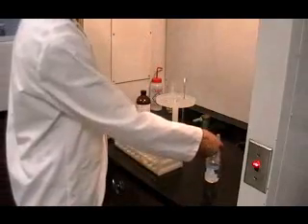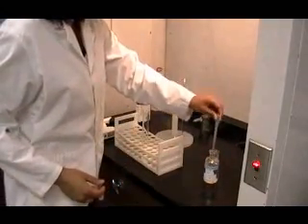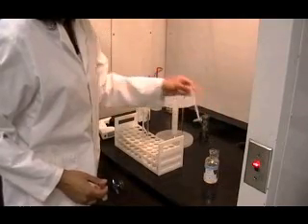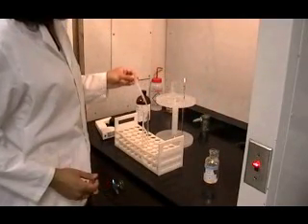Once the acetic anhydride has been added to the test tube, carefully add 5 drops of concentrated sulfuric acid. Remember, handle sulfuric acid with care.